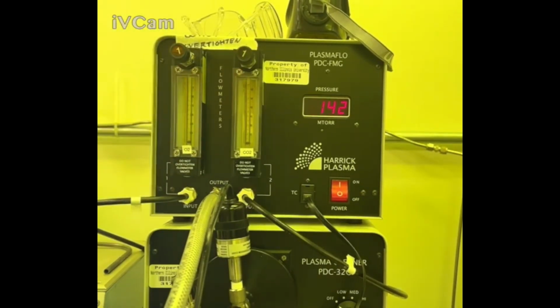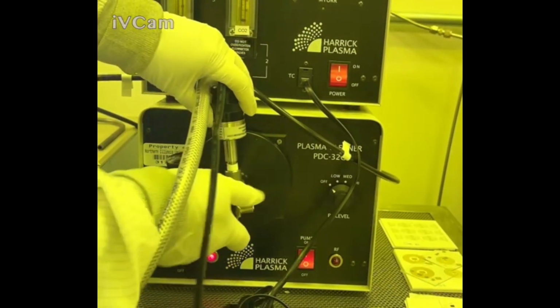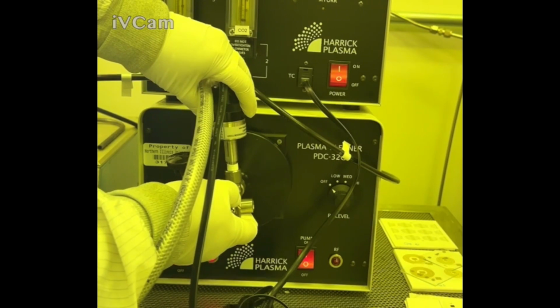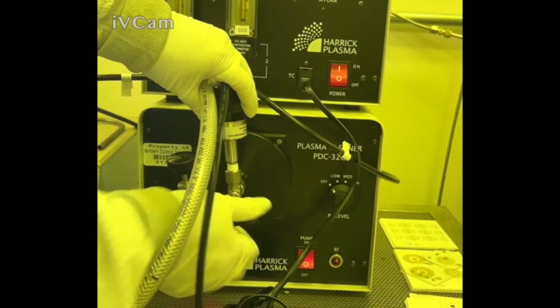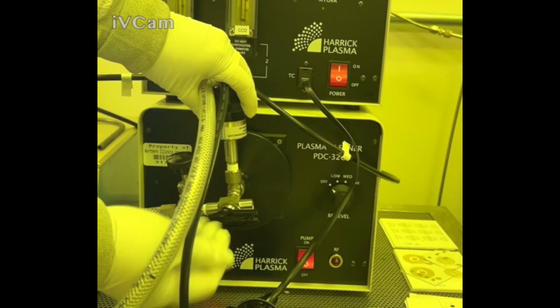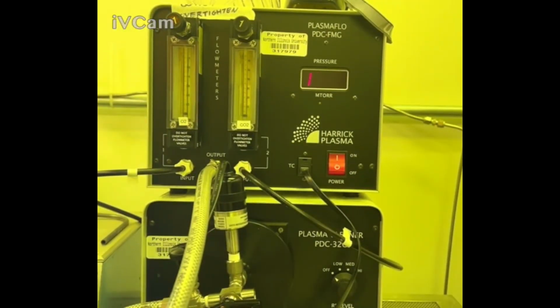Again, don't close it too tight. If for whatever reason that starts to happen, you can flood the chamber with atmospheric oxygen, which basically you just open this up very slightly by turning it left, just enough to start hearing the air get flooded in, and then you'll also see the pressure change as well. It'll jump up to 1. You really don't want to do that for more than 30 seconds. I did it for a couple of seconds, but I'm going to let it come back down to about 150.